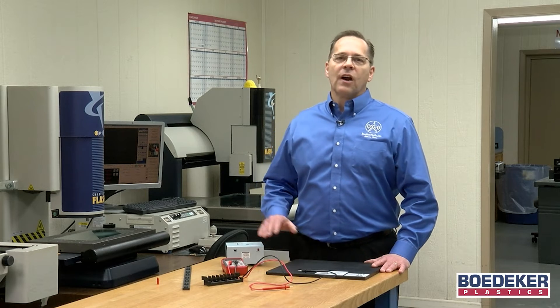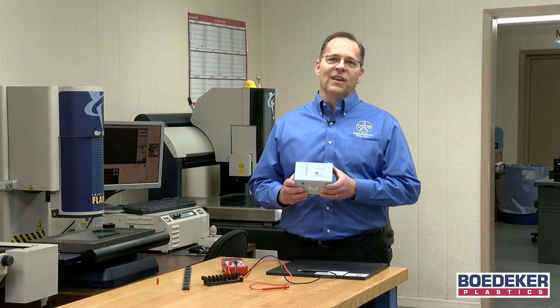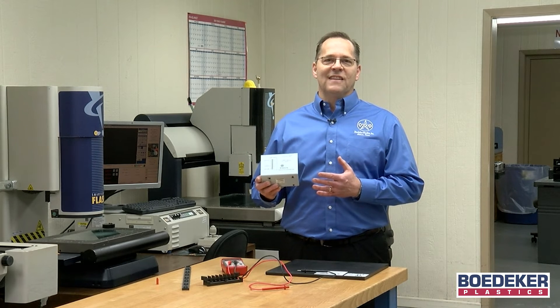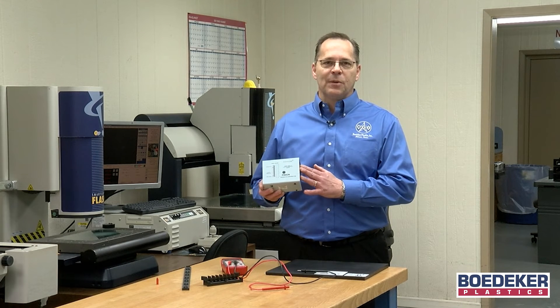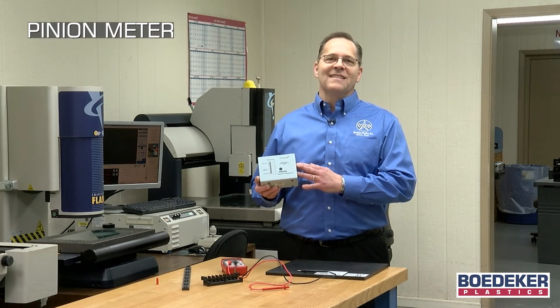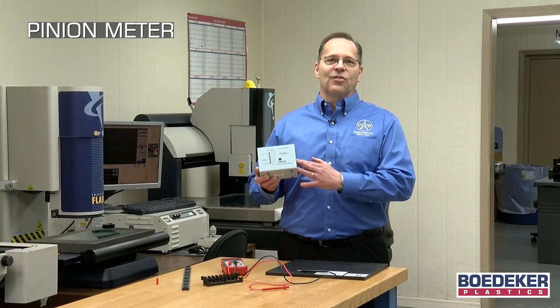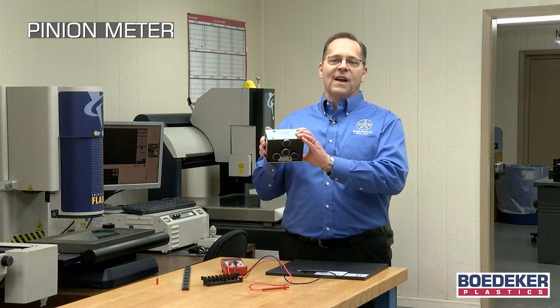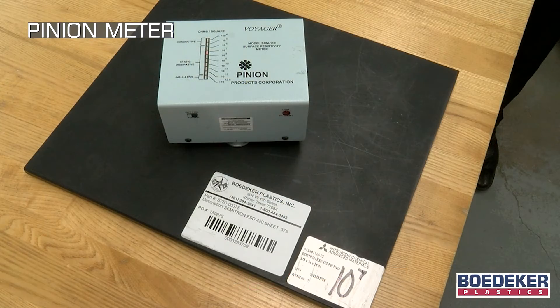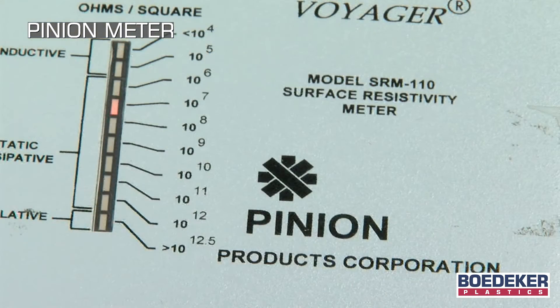There are other lower-cost, more portable probes that also measure an area-to-area resistivity and have been found to yield acceptable results. One popular device is the pinion meter. The pinion meter uses 30 volts and also has round area-to-area surface probes that require good contact with the test material.